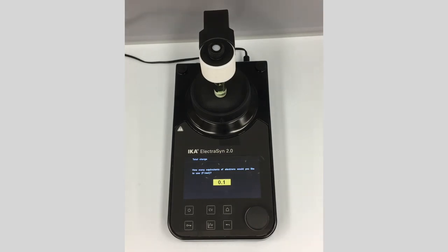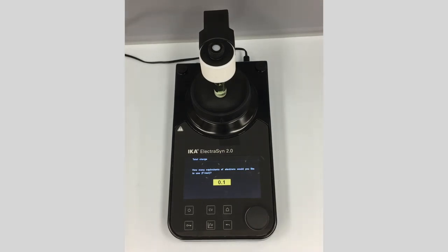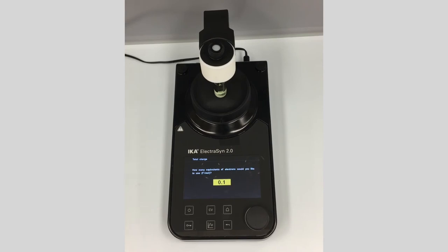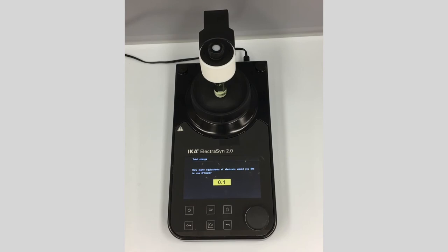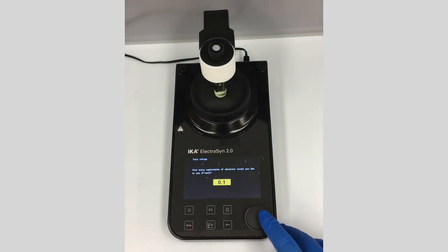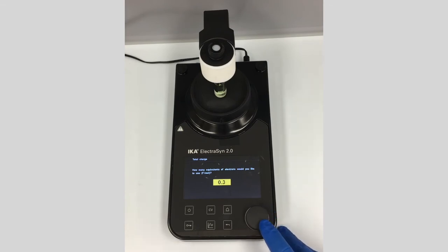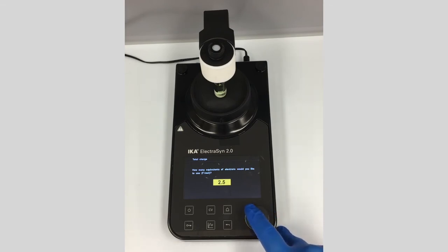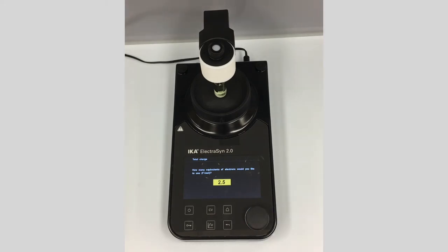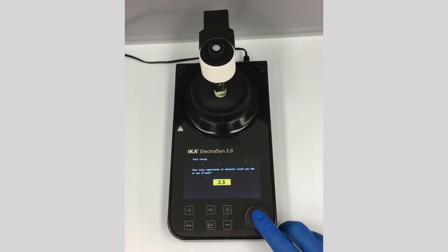It now asks for the number of equivalents of electrons you'd like to use. In the electrochemical literature this is referred to as Faradays per mole, but as a synthetic organic chemist we like to think of it in terms of stoichiometry — these are equivalents of electrons. We know this is a two-electron reductive process, so you could choose two, but I'm going to add a little more and run at 2.5 Faradays per mole. Click OK.